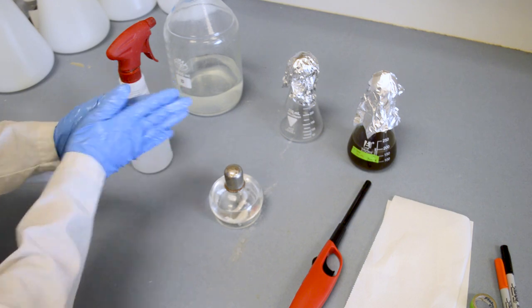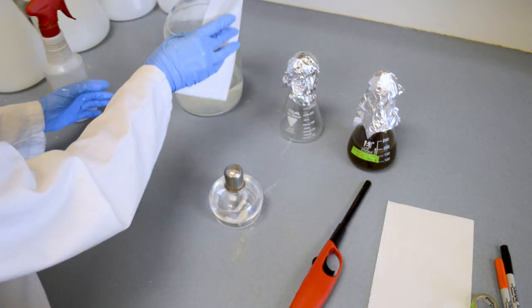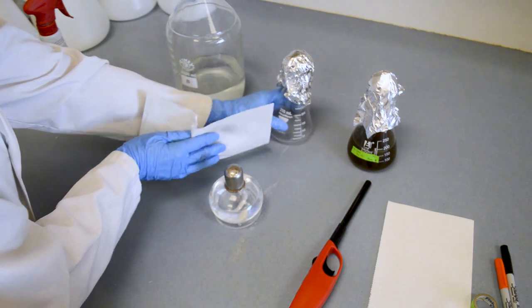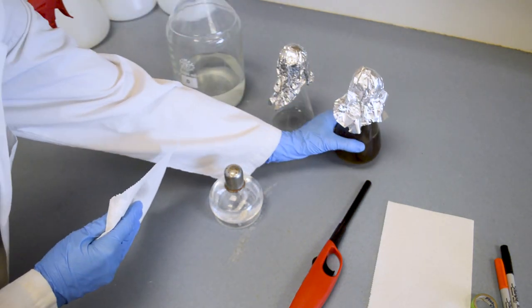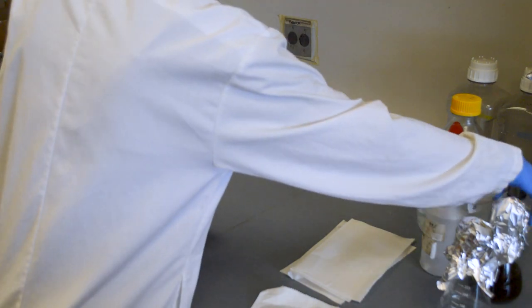Once your workspace is clean, use the alcohol spray to sterilize your hands and wipe down the outside of your sterile culture media, sterile empty flask, and your parent culture with a paper towel sprayed with alcohol. Next light your flame source.